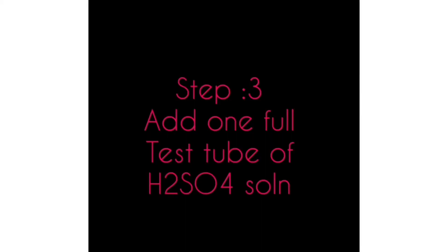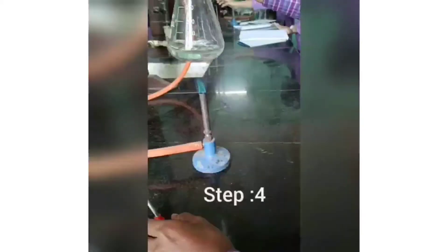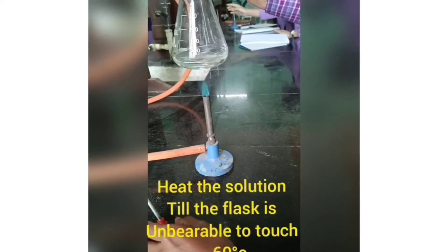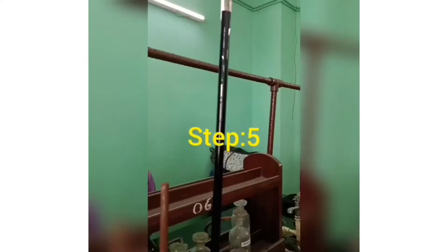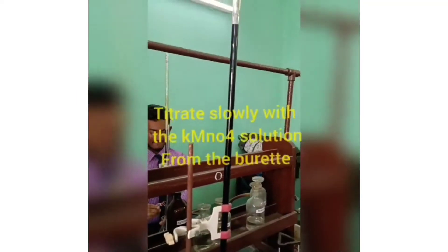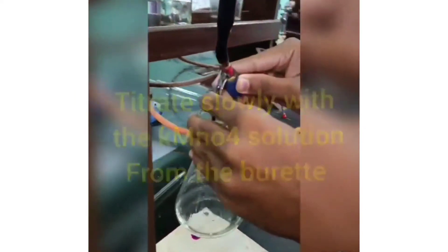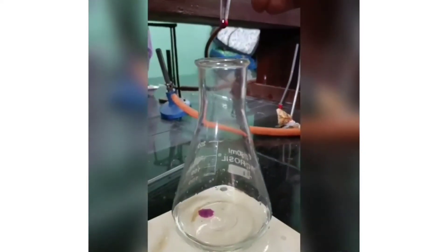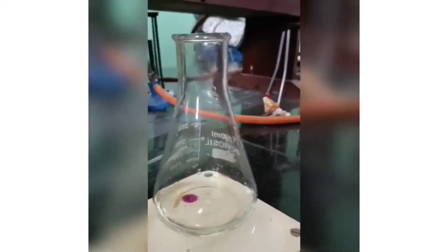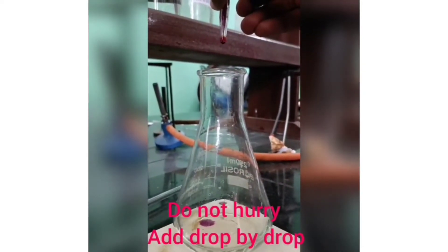Add one test tube full of dilute sulfuric acid and heat the conical flask until it becomes unbearable to touch. Place the conical flask beneath the burette and start pouring potassium permanganate solution dropwise by opening the nozzle of the burette. Stir it continuously while pouring the potassium permanganate solution to the mixture in the conical flask.